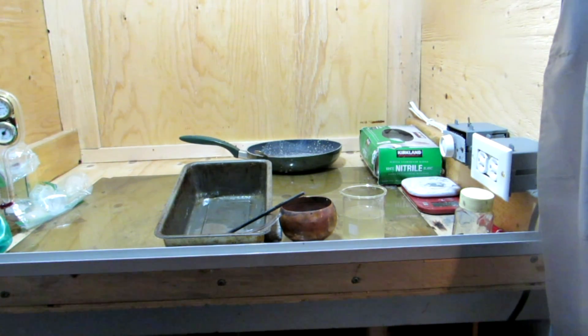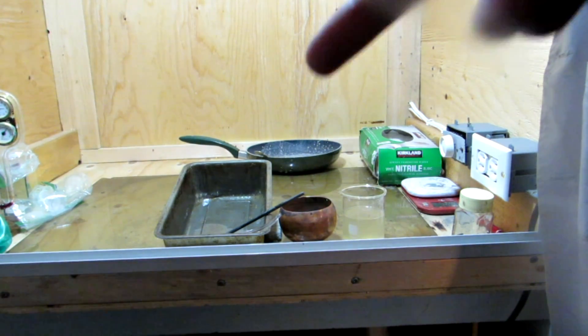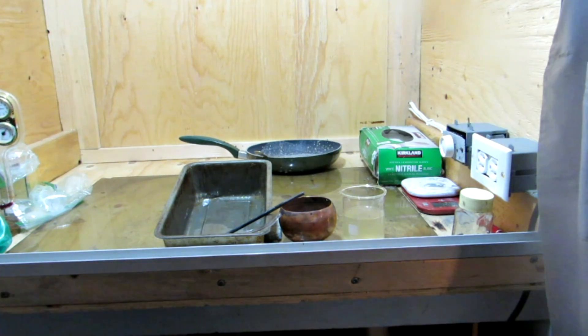I transferred everything into this steel pan and boiled it down the rest of the way. Definitely if you're going to be doing this, I'd highly recommend using only steel and no glass because the bumping is quite intense. Although half our product was lost, we still have more than enough to continue on.